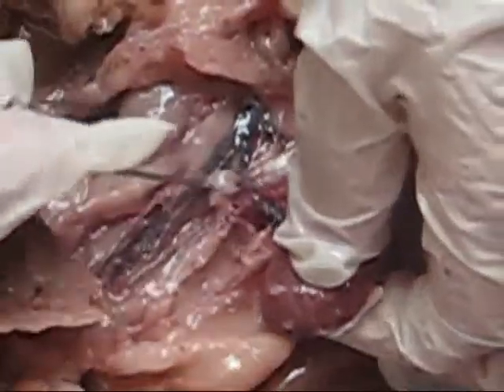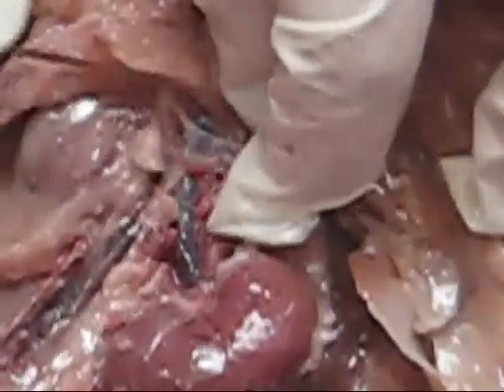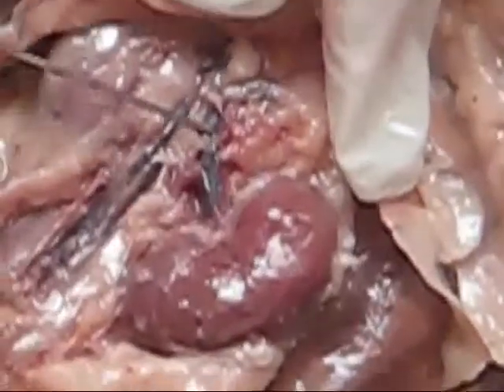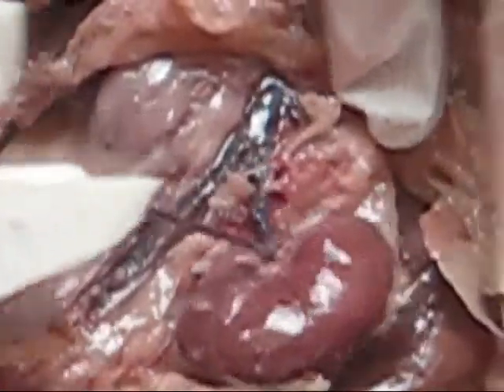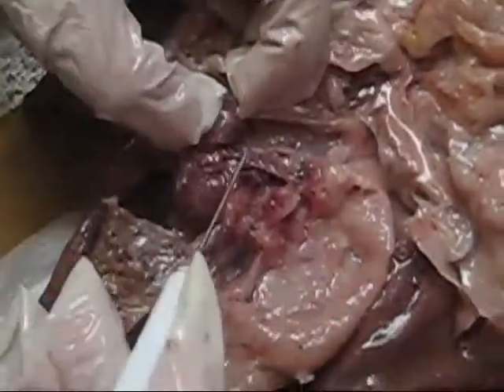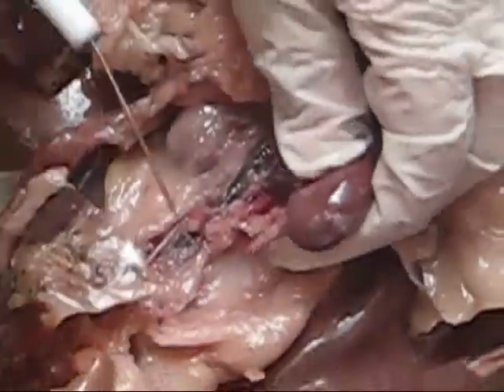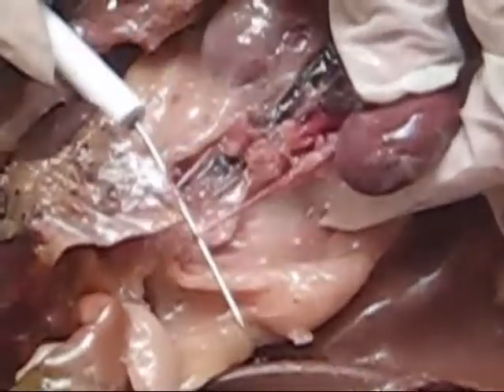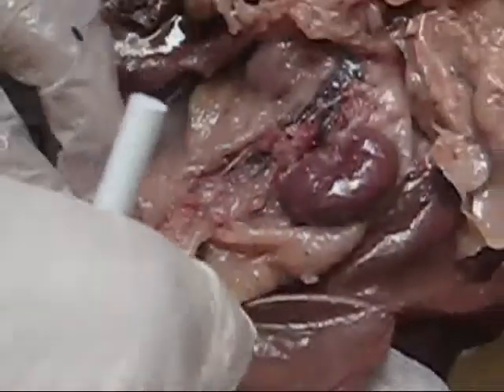This is the renal vein right here. It's going into the inferior vena cava — remember, veins go up — so this is draining the kidney, going up into the inferior vena cava. Right behind it, notice here in pink, is the renal artery. So you have the renal artery. Now, going out of the kidney, this thin tube here — this is the ureter. This is what drains the urine. The kidneys produce the urine. This goes all the way down to the urinary bladder.